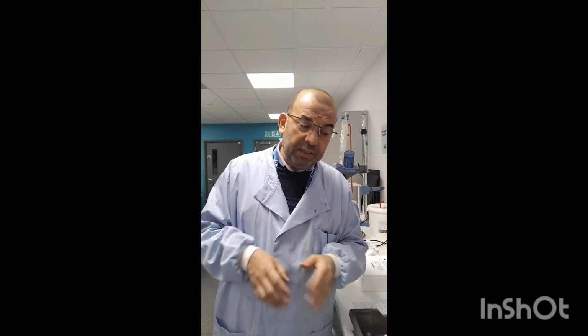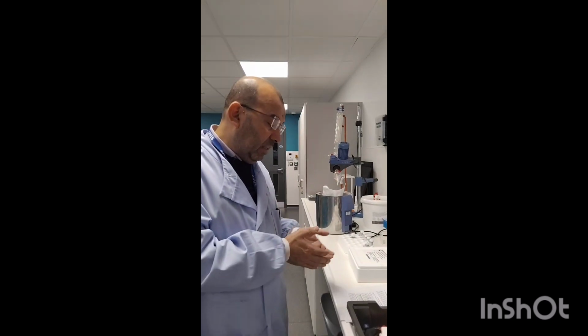Okay? When you finish that, all these calculations will be done at home. It will not be done at the lab, at the day of the experiment. After finishing the 3 sets of experiments and measuring the absorbance every 15 seconds for 3 different Excel sheets, now we'll go to the second part or second section of this experiment.